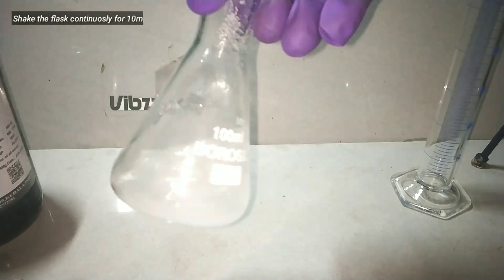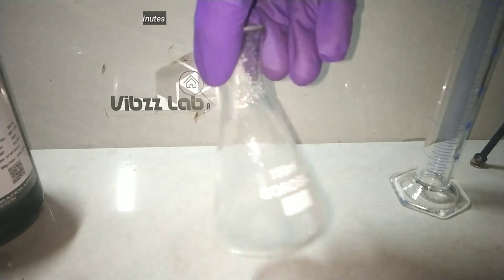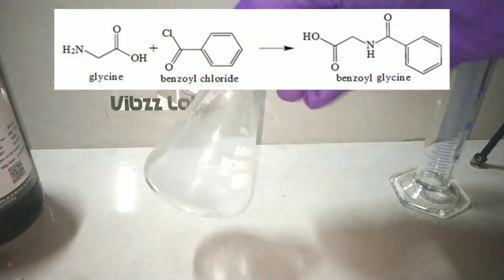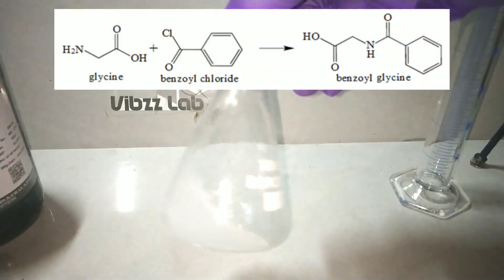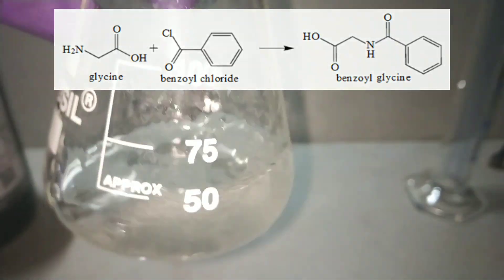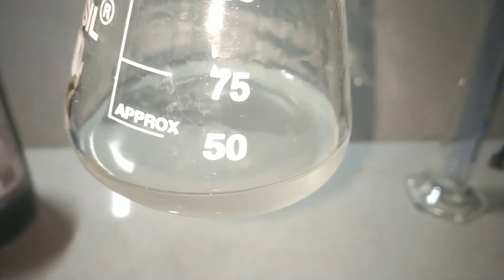After adding the benzoyl chloride, we have to continuously shake the flask to mix the contents very well. The shaking should be done continuously for a period of 10 minutes until the benzoyl chloride completely reacts with glycine. You can tell by noticing the disappearance of oily droplets — the contents of the flask will become clear, as you can see.